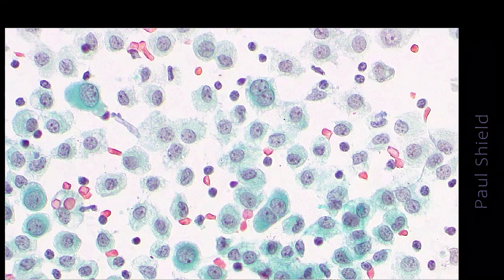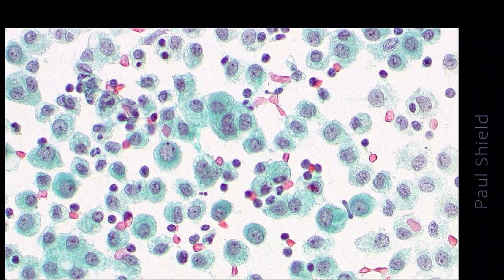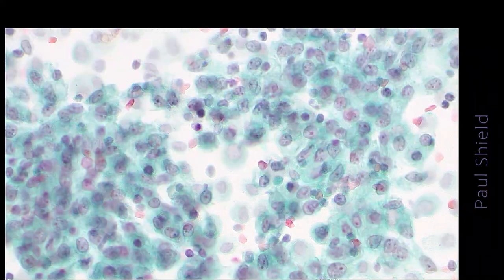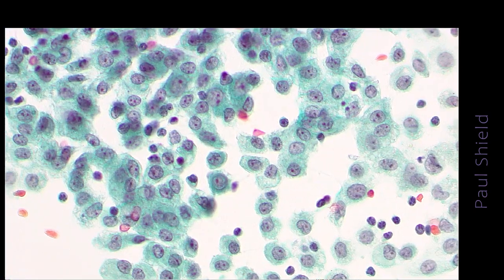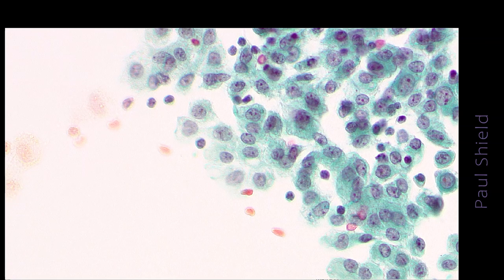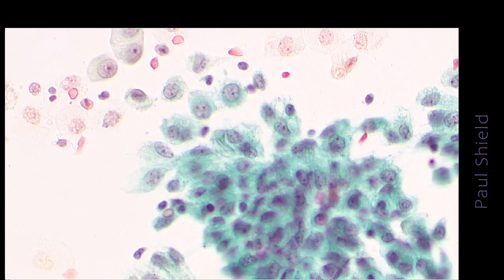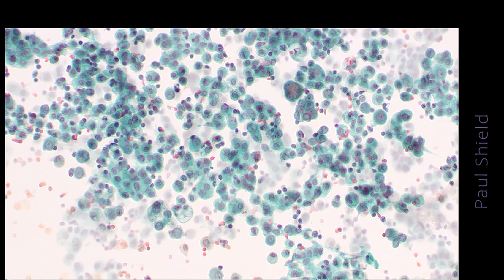This is a reactive case with a pap stain. You can see fairly prominent nucleoli in just about all the cells here, a little more tendency towards grouping. Here you have more grouped looking cells, and again they have quite a degree of uniformity to them, so pretty much all the same size and shape nuclei, same NC ratio.